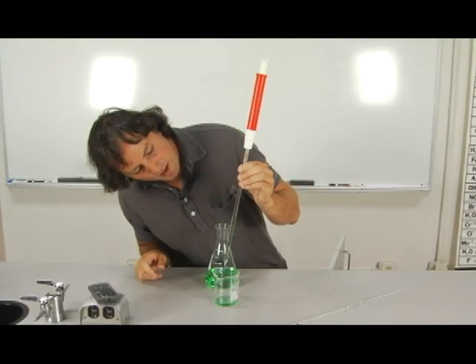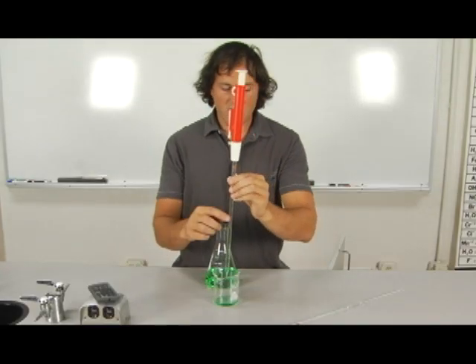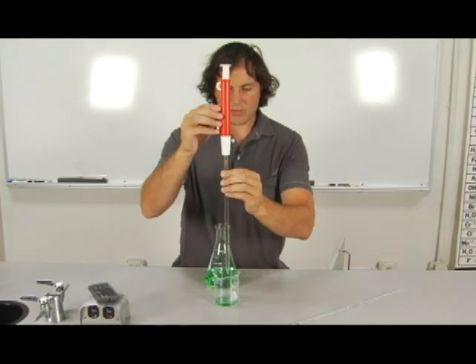All right. Now I've accurately added 4.3 milliliters of fluid from this Mohr pipette.